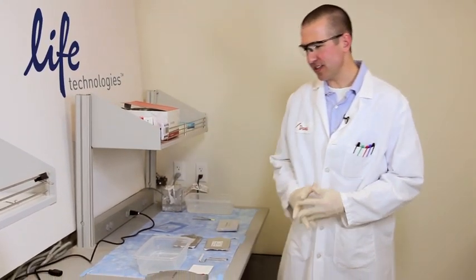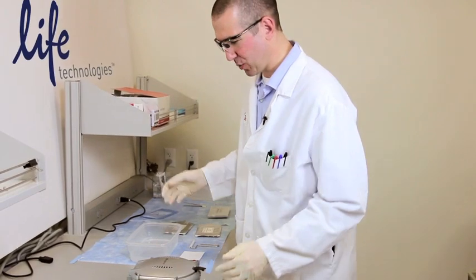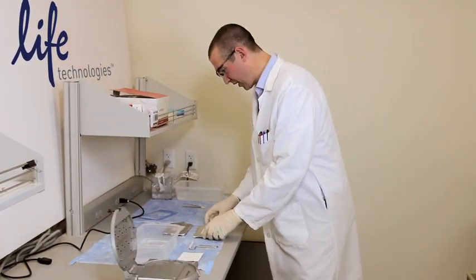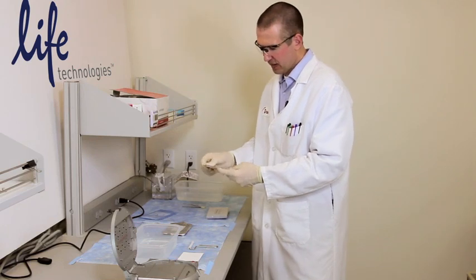Okay, so let's go through the steps of an iBlot. We have our iBlot apparatus here and let's go ahead and unwrap our anode stack.